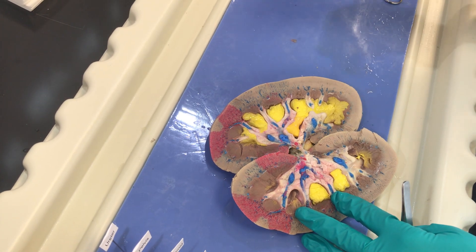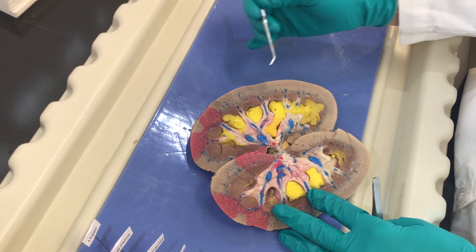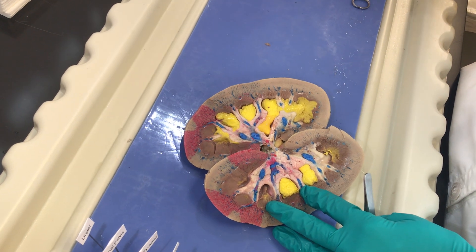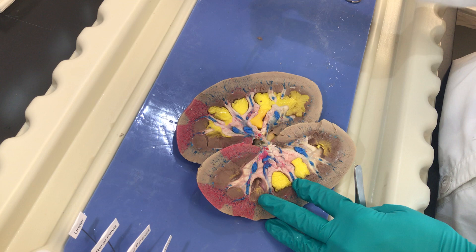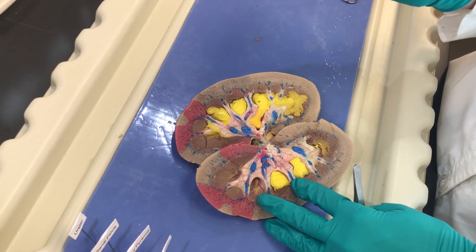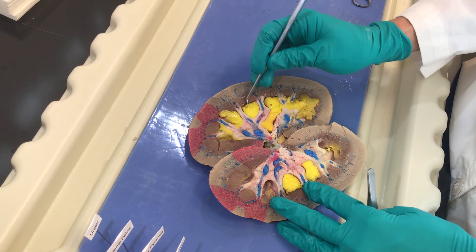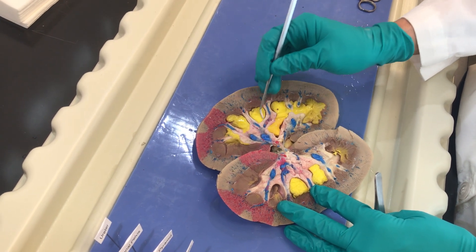Additionally, as we have all these nephrons within here, as the nephrons empty into the collecting ducts, you'll have your cortical collecting duct, medullary collecting duct, and papillary collecting duct, which will then drip the filtrate into this space.